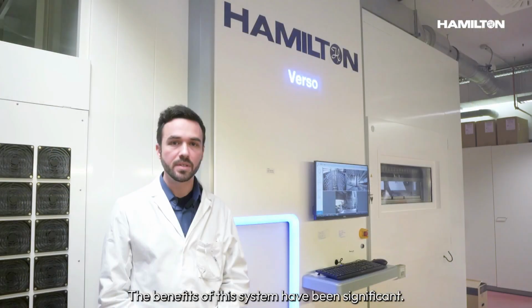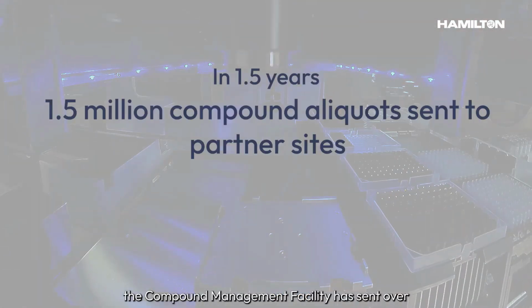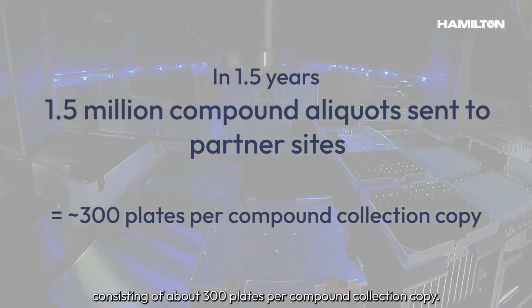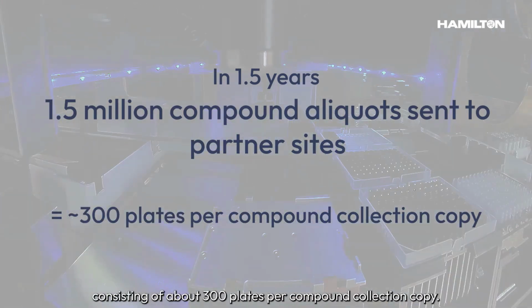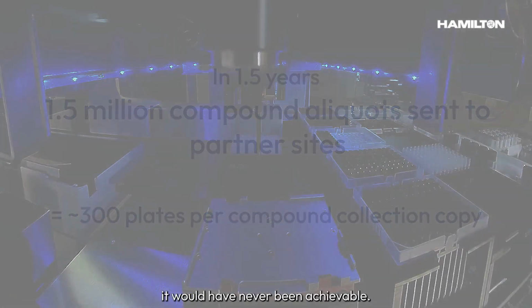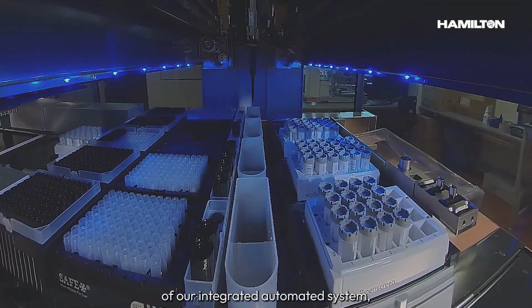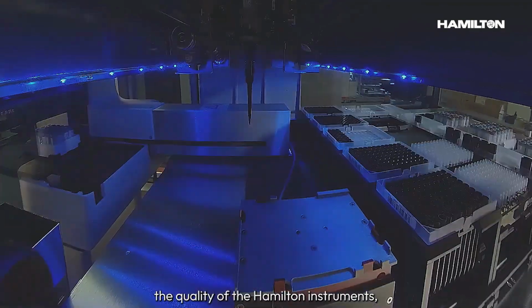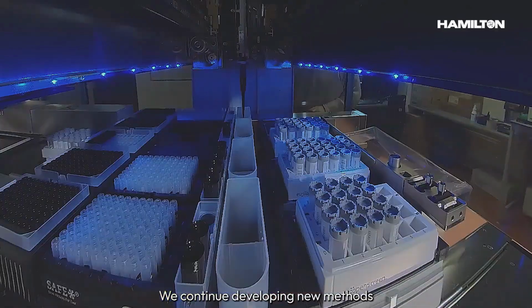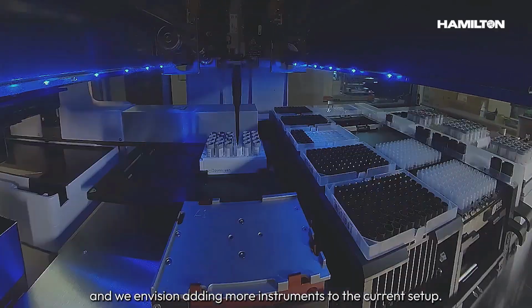The benefits of the system have been significant. Within 1.5 years, we have sent over 1.5 million compound aliquots to partner sites, consisting of about 300 plates per compound collection copy. Without this highly integrated automated system, it would have never been achievable. We are very pleased with the flexibility of our integrated automated system, the quality of the Hamilton instruments, and the support of the Hamilton team. We continue developing new methods to automate more tasks, and we envision adding more instruments to the current setup.